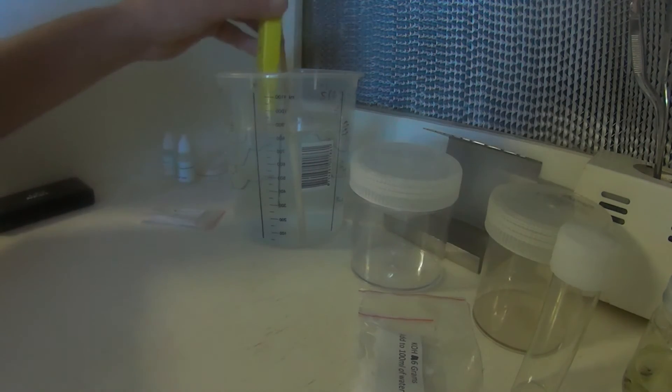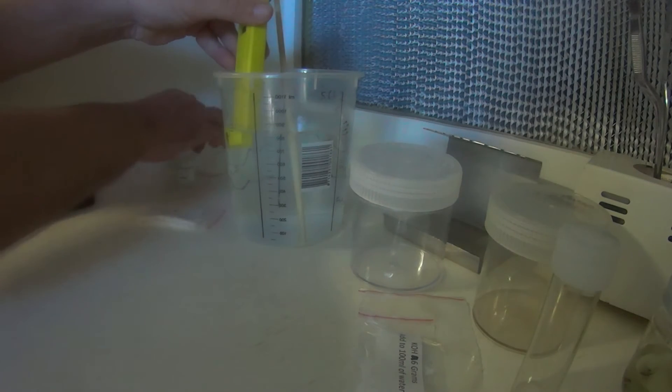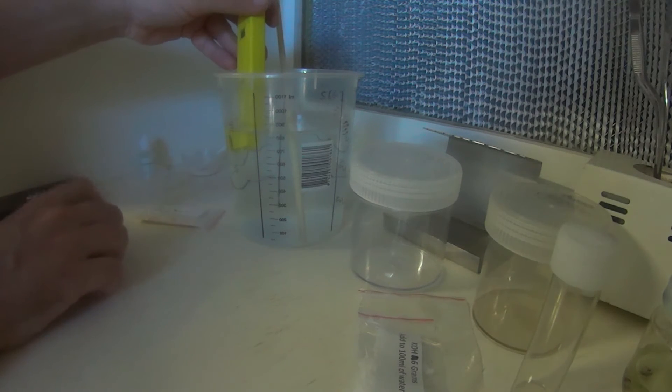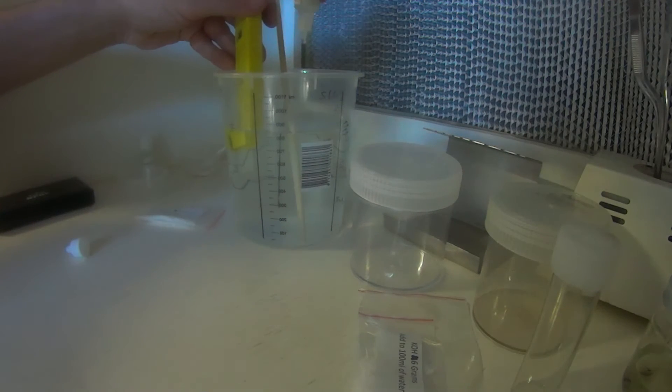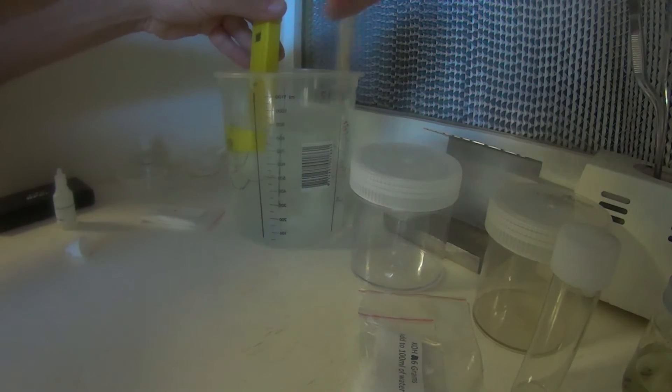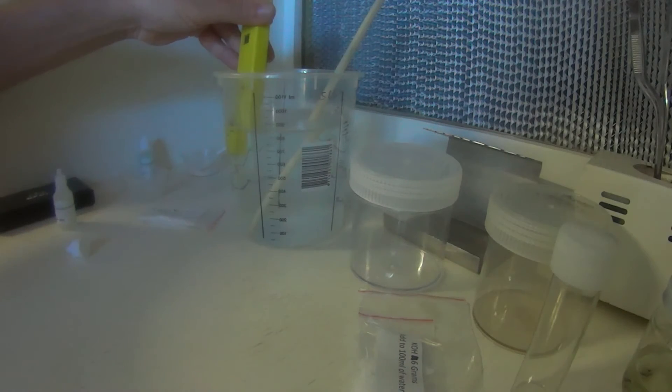So we tested it, we need to adjust it up a little bit, so we'll go the pH up, and add a couple of drops. There we go. That should bring it up closer to the mark, 5.5, 5.6 is what we're after at the moment, and 5.4, which we have done. Like I said before, this pH meter is included in the number one kit as well.